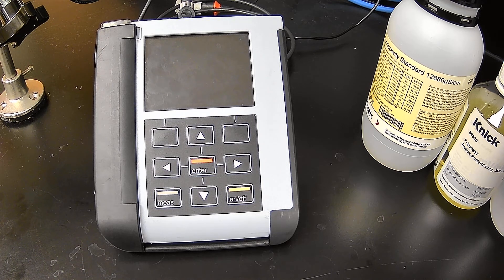Hello. We're going to do a calibration of an SE615 two-electrode conductivity probe. This is a portable analyzer that I have with me - the Portavo 907 multi-oxy. We're going to use it for calibration of a conductivity electrode.